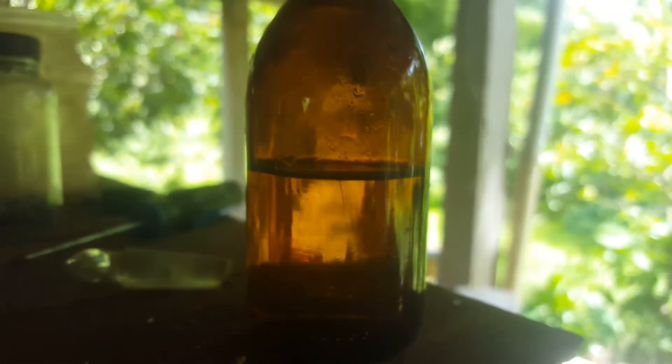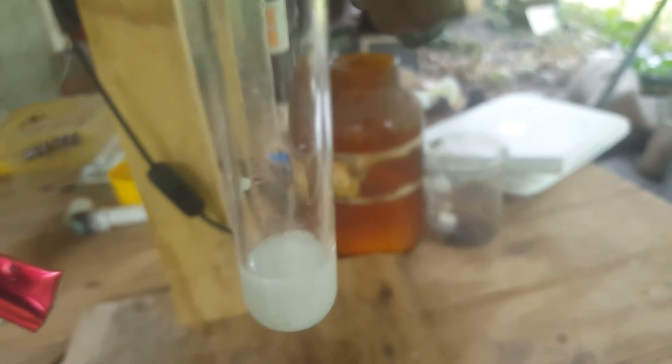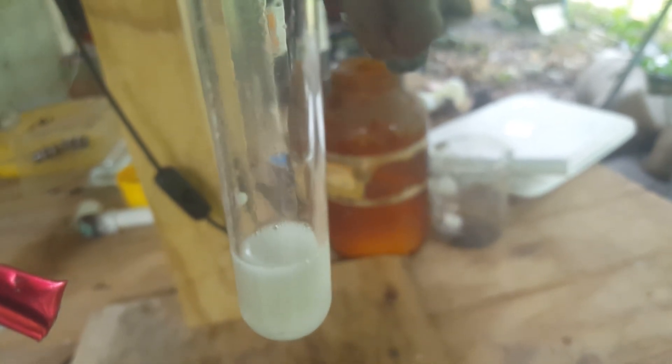This is possibly due to impure reactants or too much water in the reactants. This unfortunately is not good enough for making alkyl bromide but is okay for some inorganic chemistry.